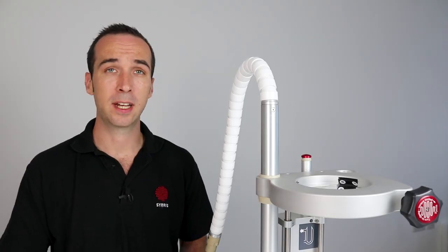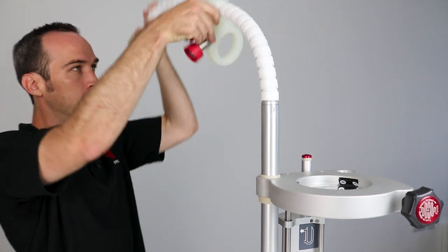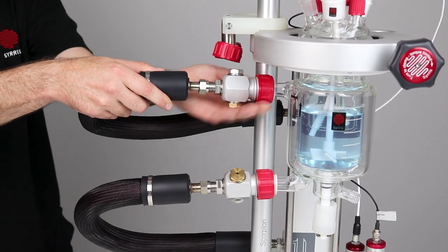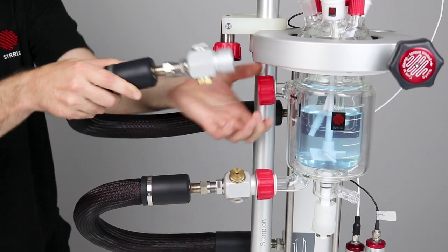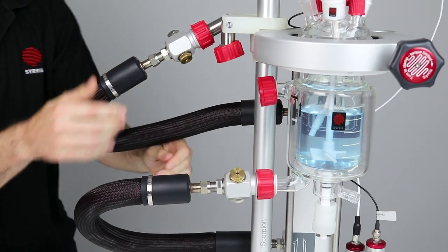With the vessel clamp in place we can now position the oil pipe tidy. This allows you to keep your oil pipes out of the way in an elevated position while swapping vessels or any time they aren't in use avoiding any oil leaks.